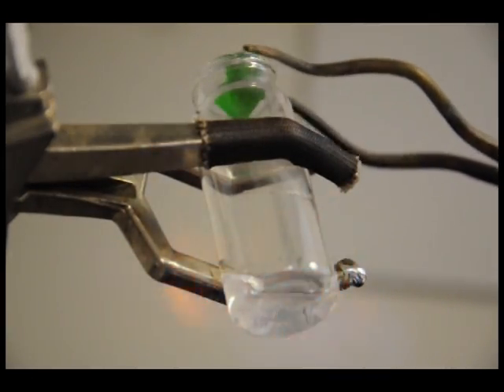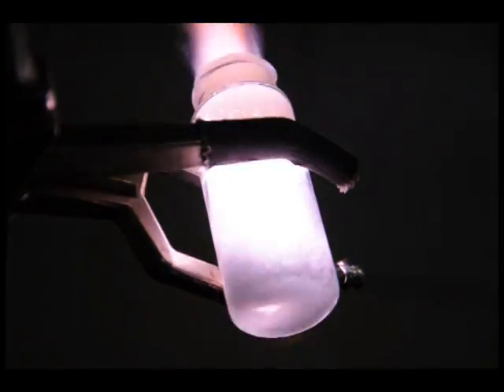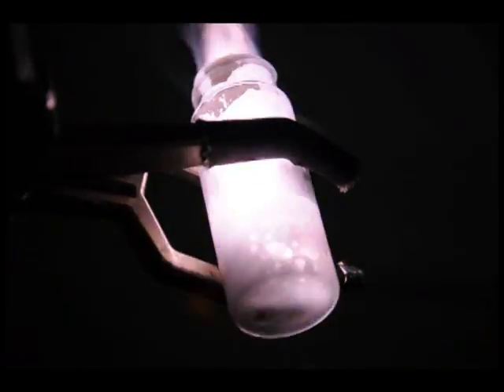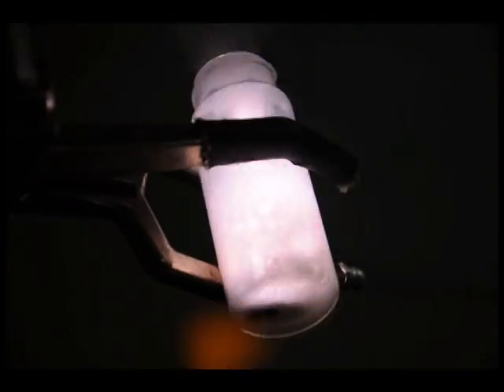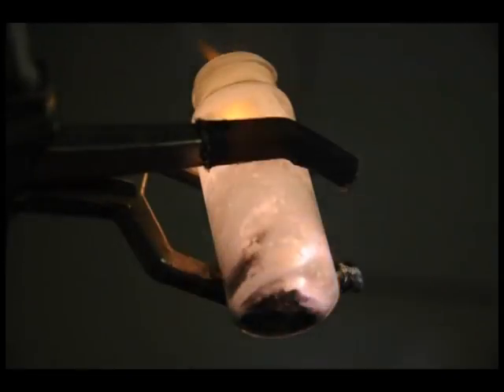As the reaction progresses, we convert potassium chlorate to potassium chloride, and the sugars in the bear into carbon dioxide, water, and carbon in an oxidation reduction reaction, which produces a good deal of heat and a slightly purple flame due to the potassium.